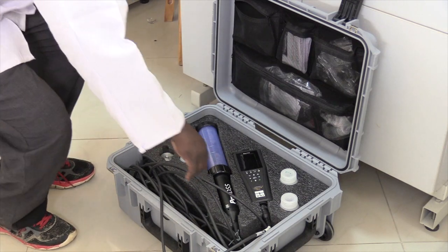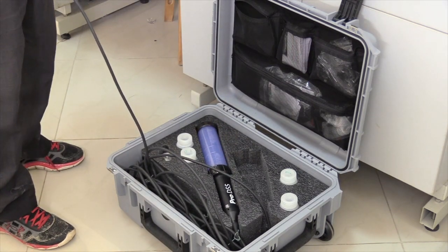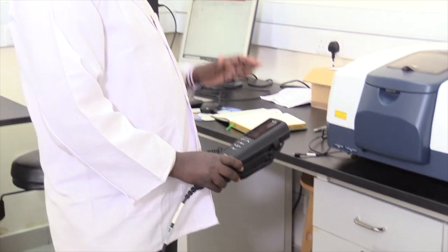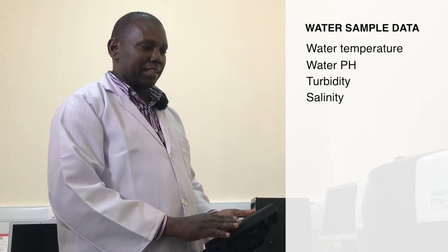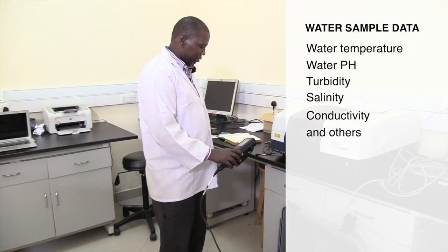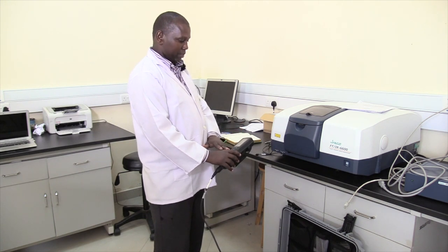Once back from the field, we have to export the data recorded from the field to a PC. This data covers the physical characteristics of the water sample, including temperature, pH, turbidity, salinity, conductivity, and others. To export the collected data, we disconnect the computer part of the instrument and connect it to the PC.